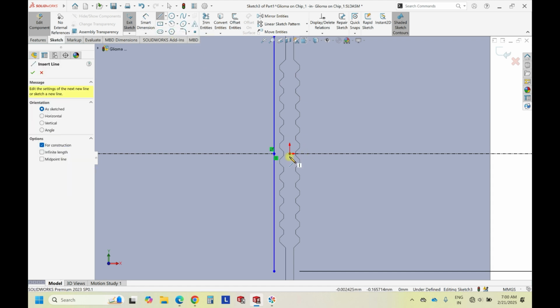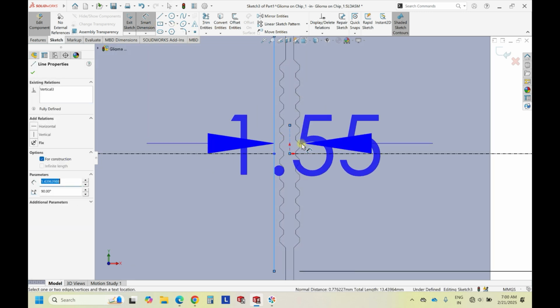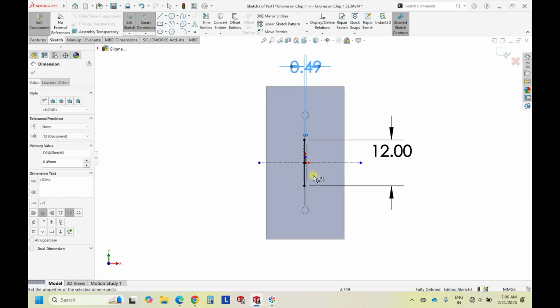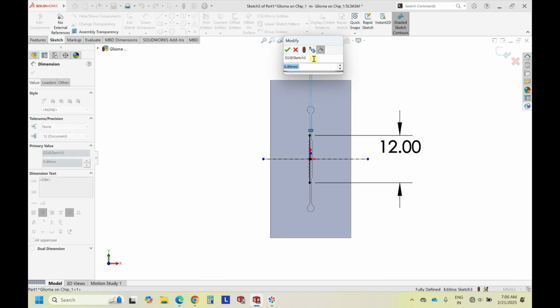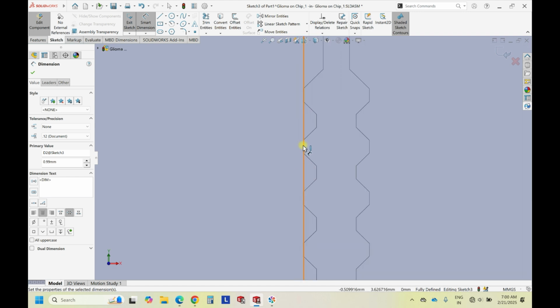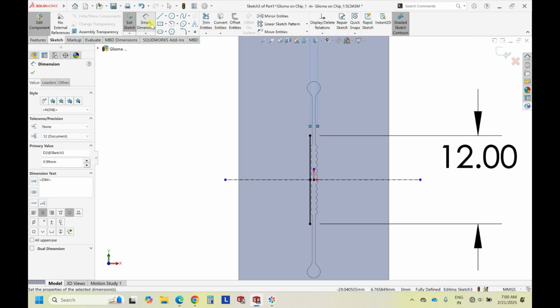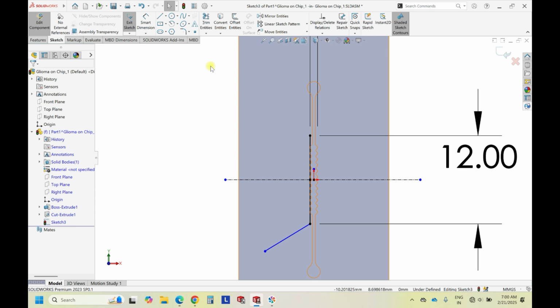Initially, let's draw a center line. And we know that the design was a 1 mm groove channel. So now let's do one thing. 0.49 I am giving. So when you extrude it, sorry, it should be 0.99. Okay, so it means that there is a 0.01 mm gap. Okay, so during the operation you will understand. And the next, it can be a line over here. It's a simple line.